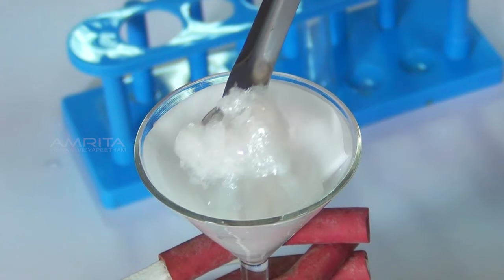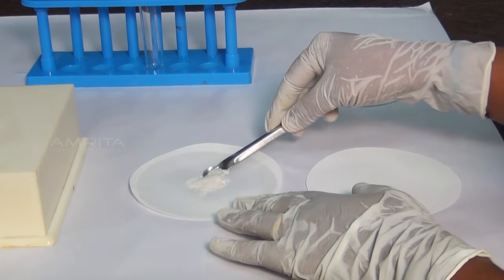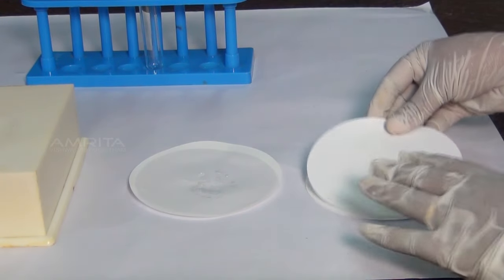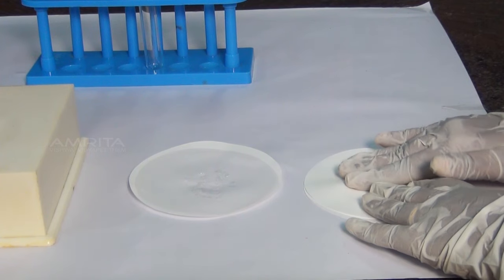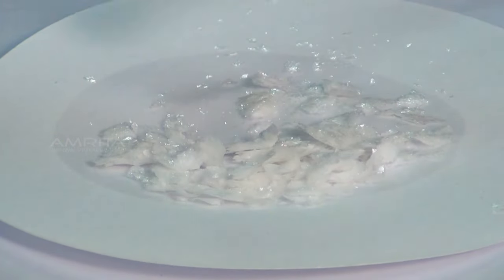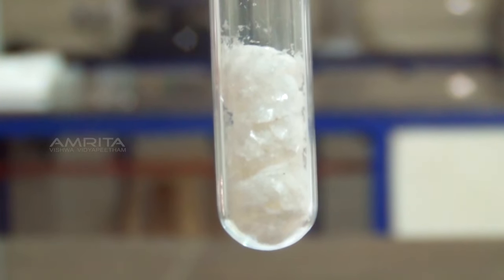Place the crystals on a filter paper which soaks up the solution. Transfer the crystals to another filter paper and dry them by pressing gently between the folds of the filter paper. Now transfer the crystals into a dry test tube. The crystals of benzoic acid are opaque white.